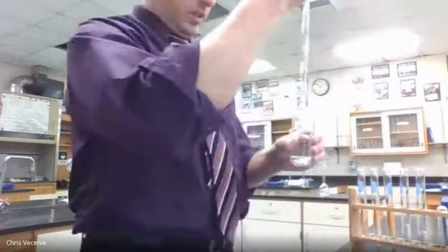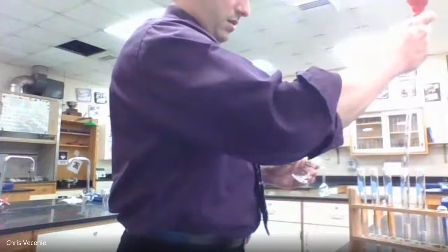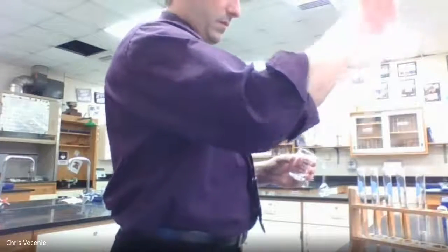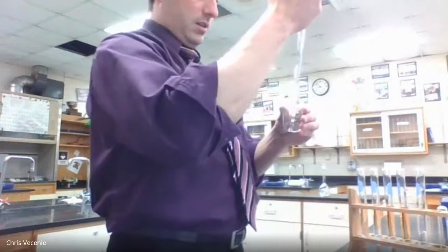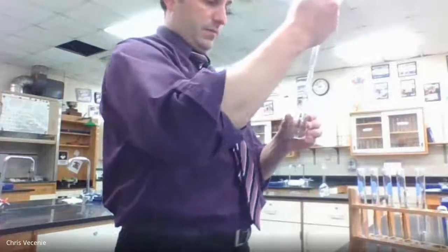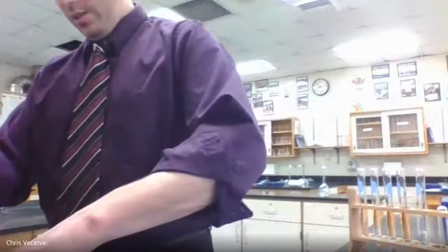Let me turn it so you can see it a bit. Then 5. And then last but not least, I need 6 for the last one. Not quite enough in there, so we're just going to add.